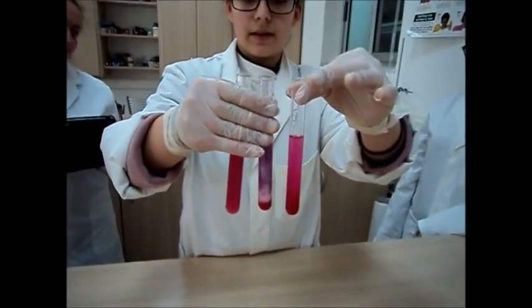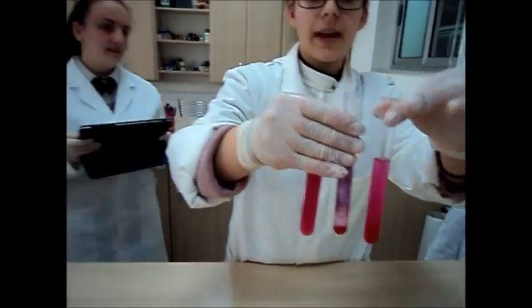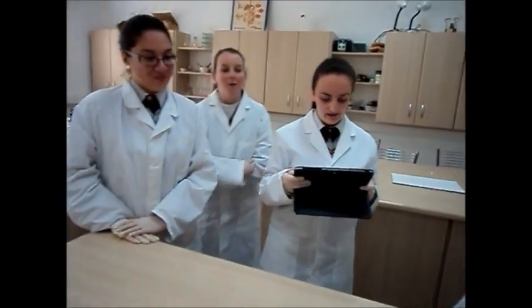I think with the alkaline it works best. Yes, it turns darker. However, with the acid it also turns darker.